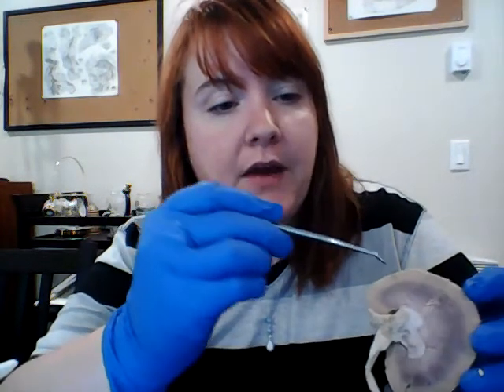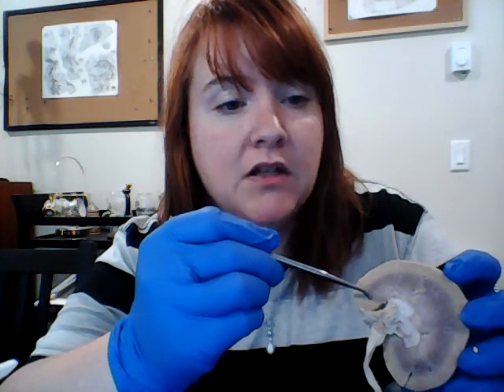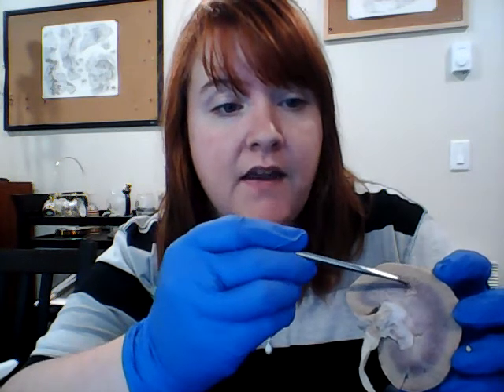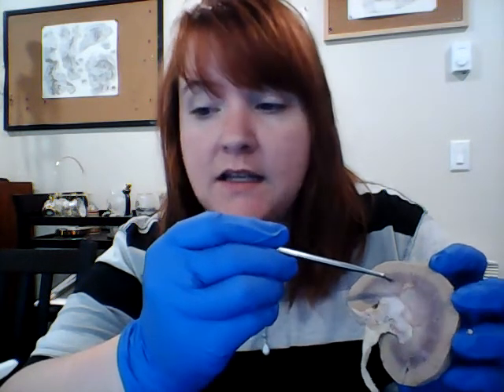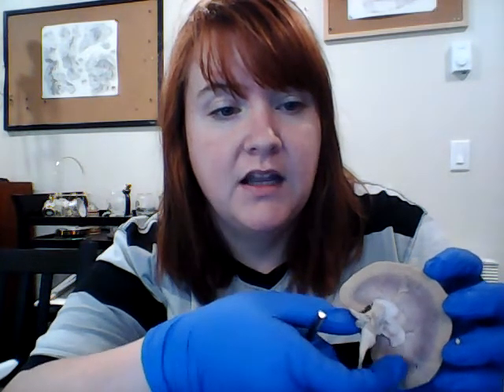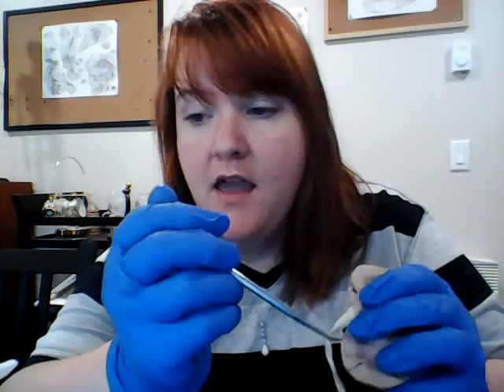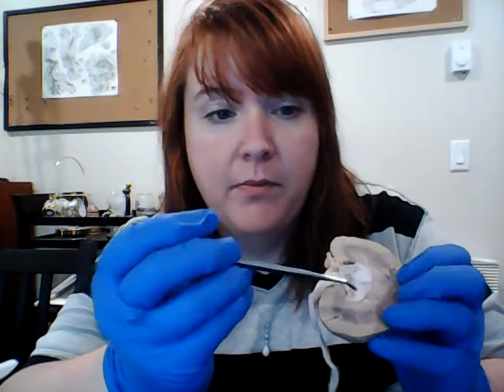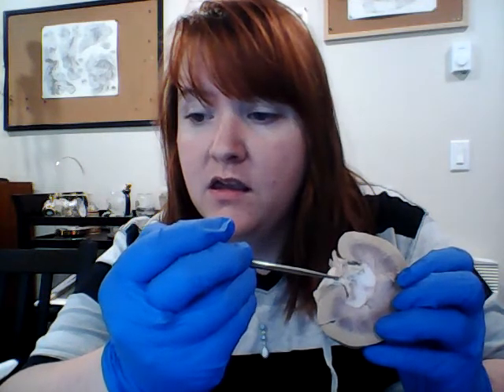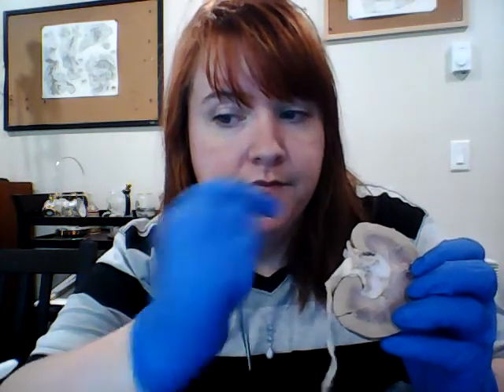So just to recap, we have the renal cortex, the renal medulla, which houses the renal pyramids, the columns, and the minor calyces. And then inside of there, we have the sinuses. We have the renal hilum, which is here, this whole section, kind of like that part right there. And then we have the renal pelvis, which is here. We have the superior portion of the ureter. So that's it.